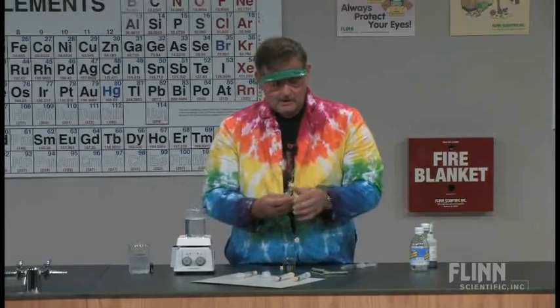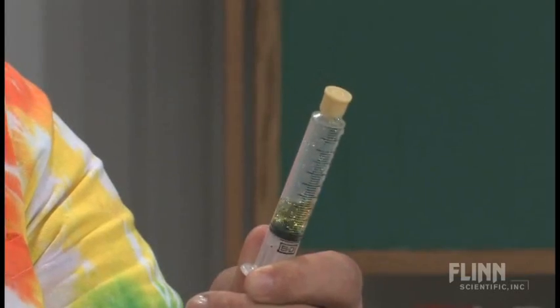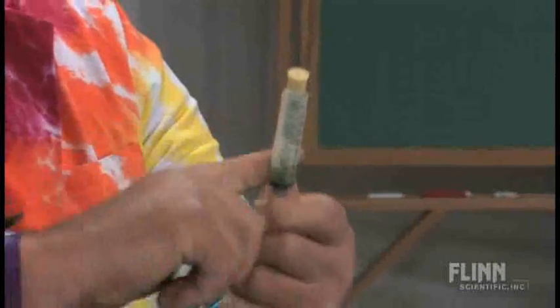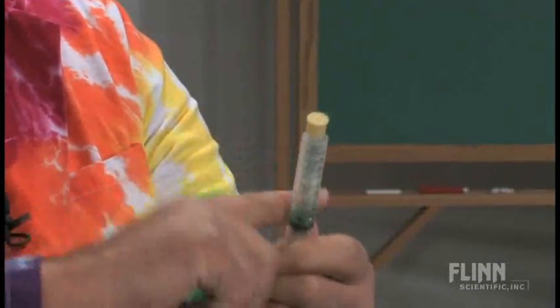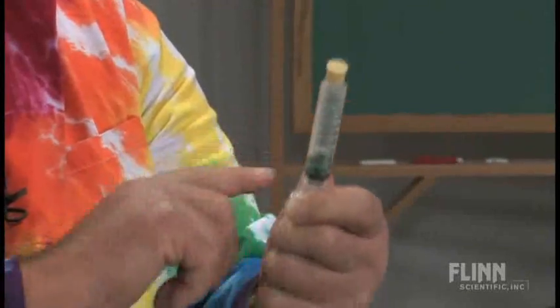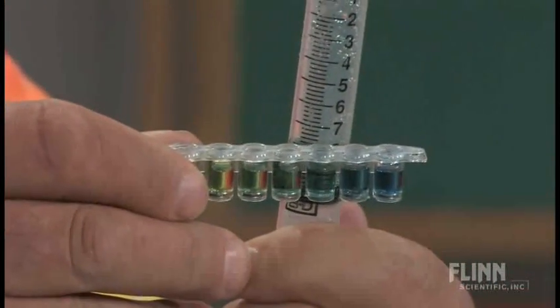I tell them what you want to do is pull the syringe back, not all the way out, tap it, and see if you can get a color change. What I'm doing by tapping it is I'm disturbing the equilibrium in there and reestablishing a new equilibrium. And then if I can get a close-up of that, right about there.